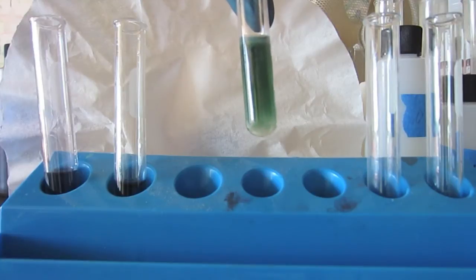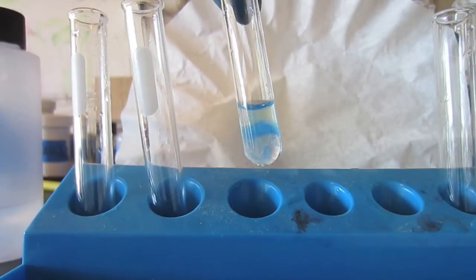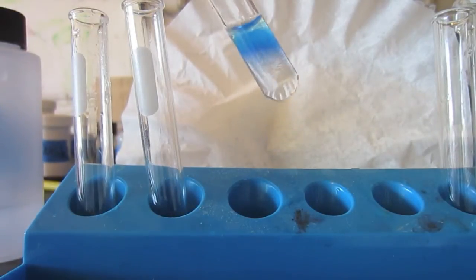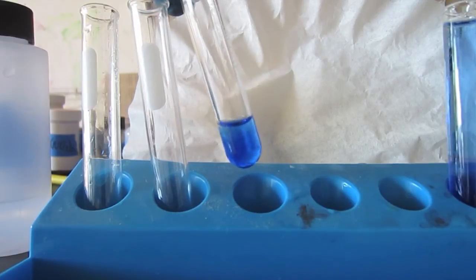It took a lot of prep, and it ended up taking me about five lab hours, but it was totally worth it. The images you are seeing are very cool color changes I got from various parts of the experiment.